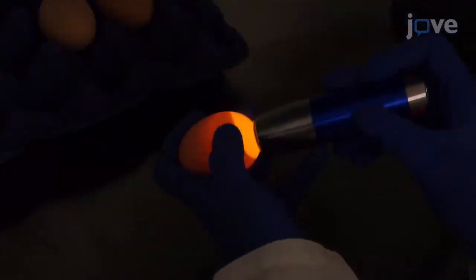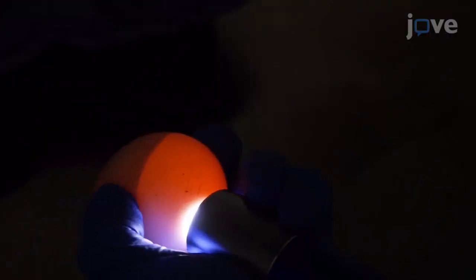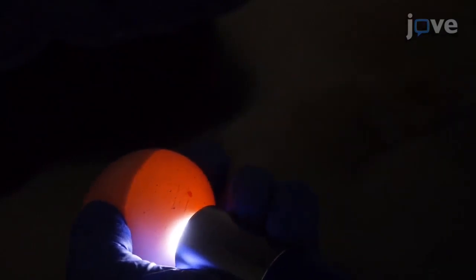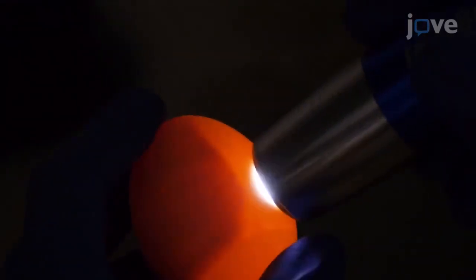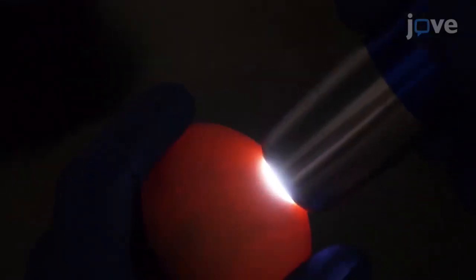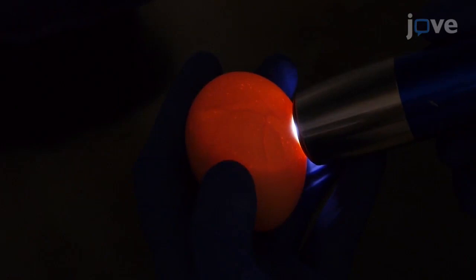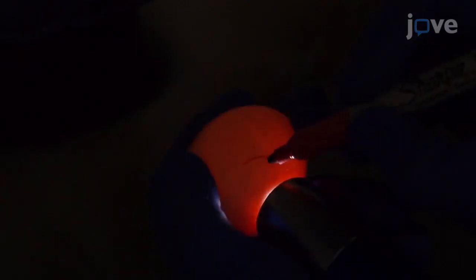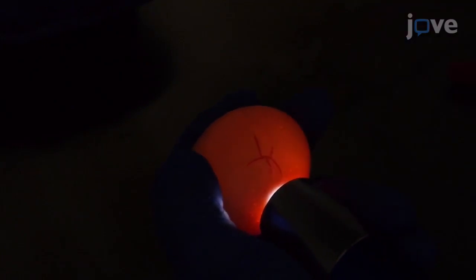With the lights turned off, place an egg candler against the eggshell to identify and mark the location of the air cell. Then move the egg candler over the shell to find a large blood vessel network, rotating the egg as necessary. An ideal vasculature will branch near the middle of the egg. Use a marker to trace the vasculature to be used for implantation.